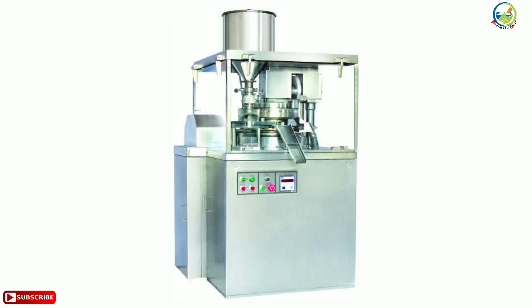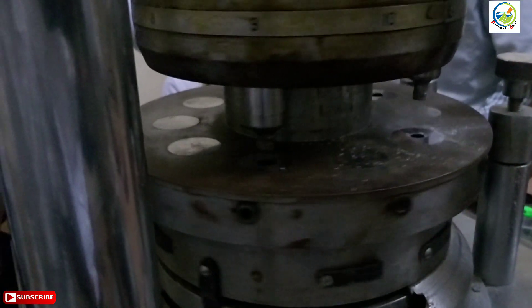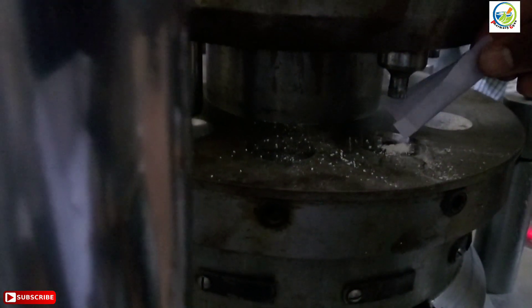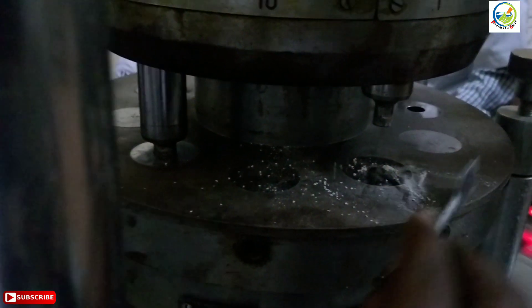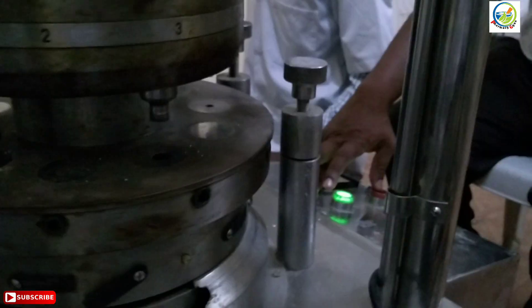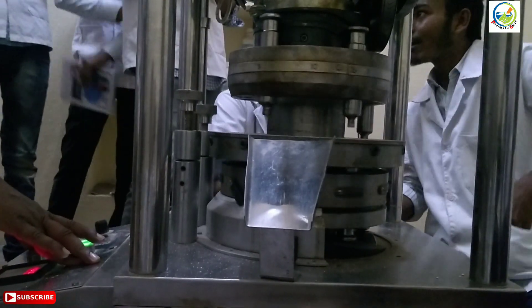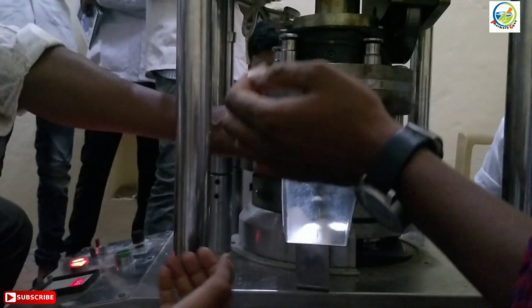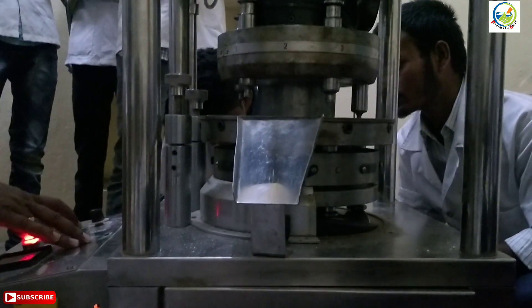Put the granules in the hopper of the tablet punching machine, select the specific pressure to prepare the tablets, start the machine, collect the tablets, and check the hardness of the tablets.